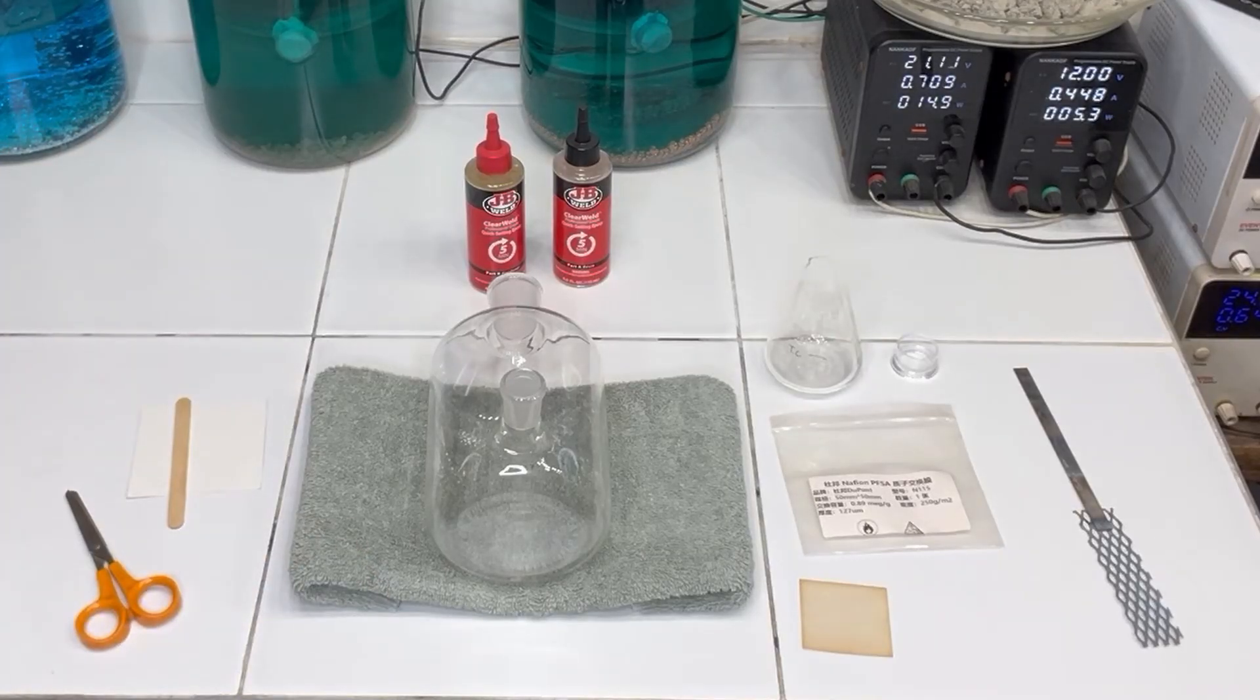So let's go over some of the items that you'll need if you want to perform this experiment for yourself and make your own sodium hydroxide just from regular table salt.